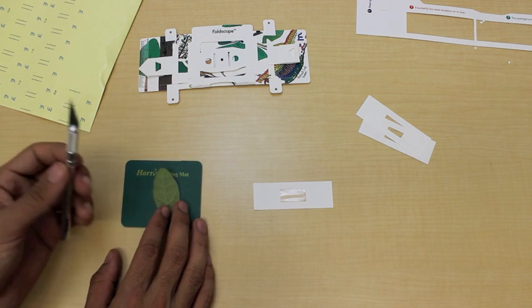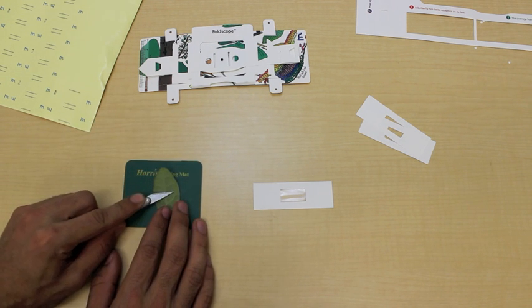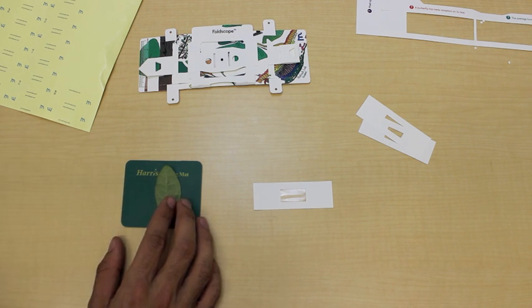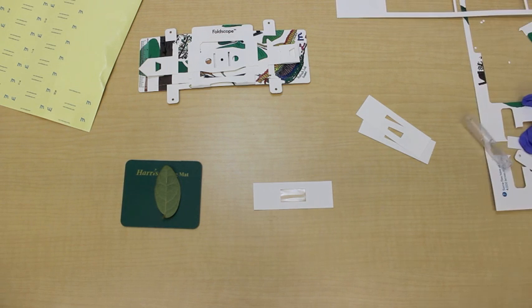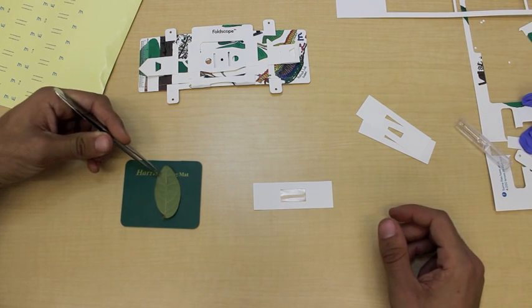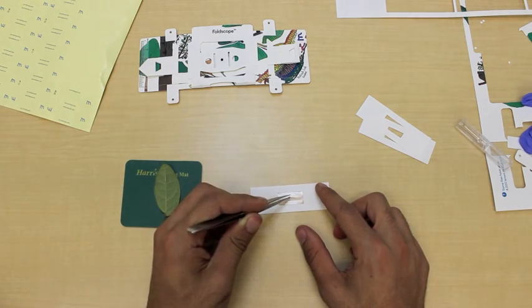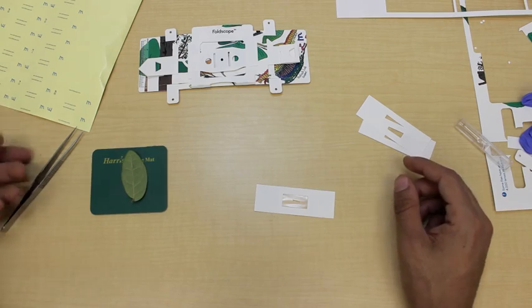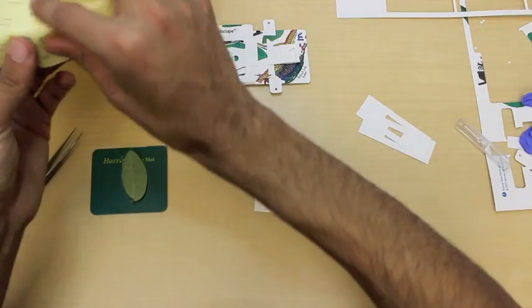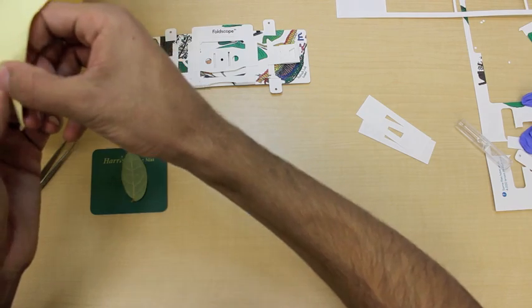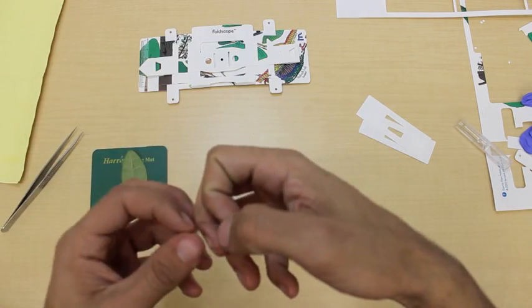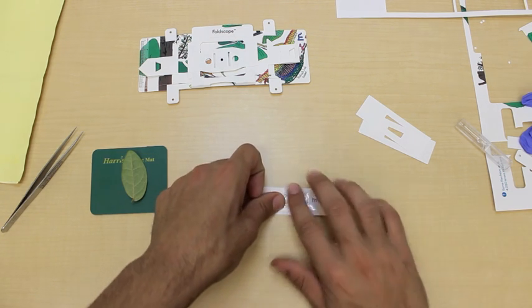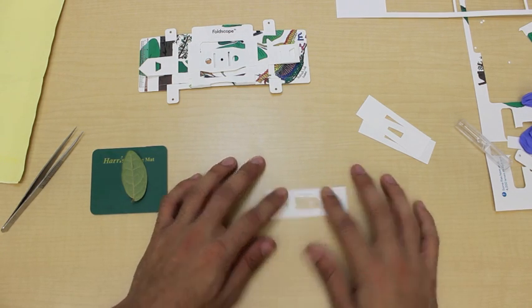We can do this in a couple different ways. One is to take an X-Acto knife and cut a thin piece of it off, and then to take a pair of tweezers and put this piece on the slide. Once we've done this, then we can take another cover slip and place it on top to seal it. We can then gently press down, and the slide is ready to go.